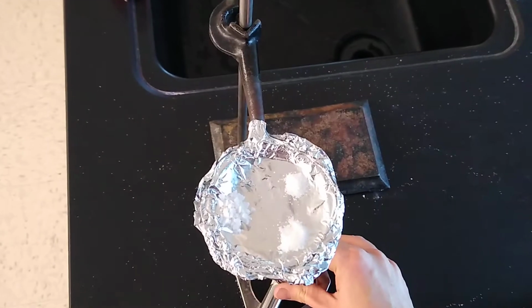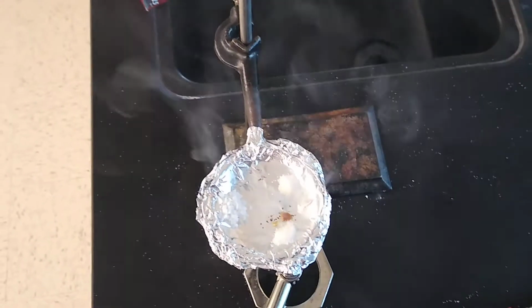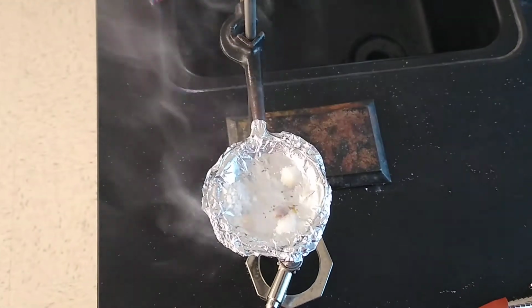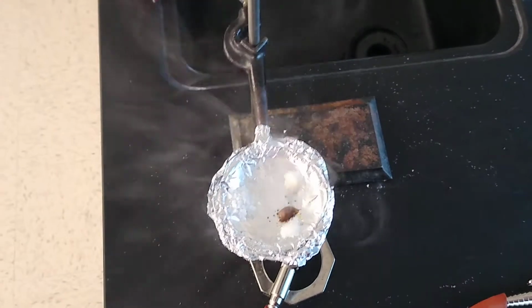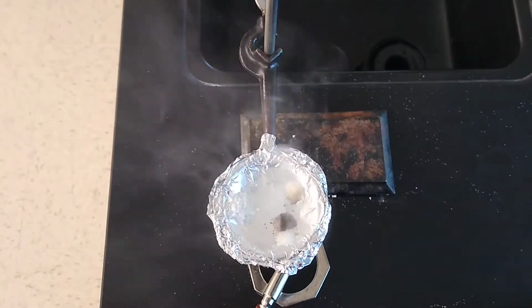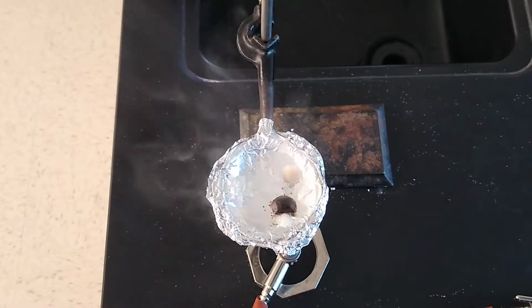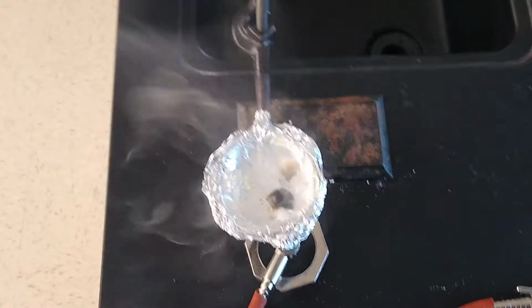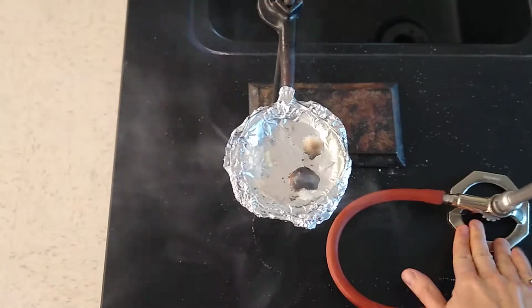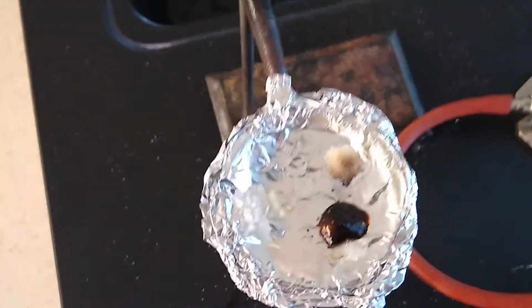underneath, and we're going to try and see what happens. Okay, so we have immediate melting on C, compound C, okay? And, ooh, it's even burning a little bit. Compound A, not much happening. Compound B, looks like it's sort of starting to melt right now, but still pretty chunky. I'm going to take that out of there because that smells bad. And then we'll zoom in here and take a look at what we have.